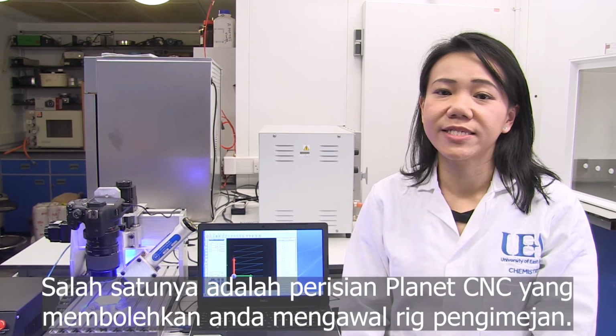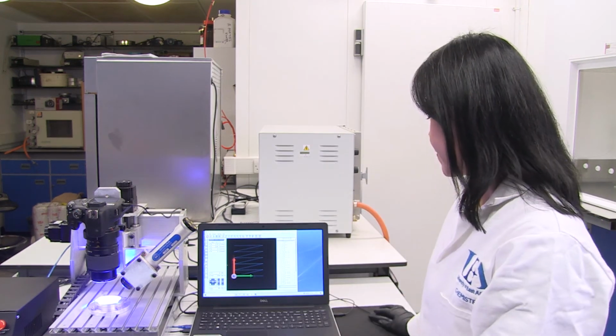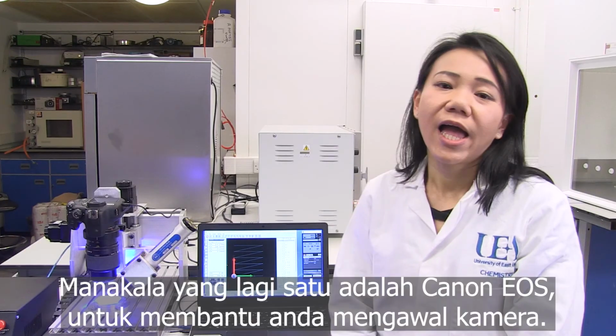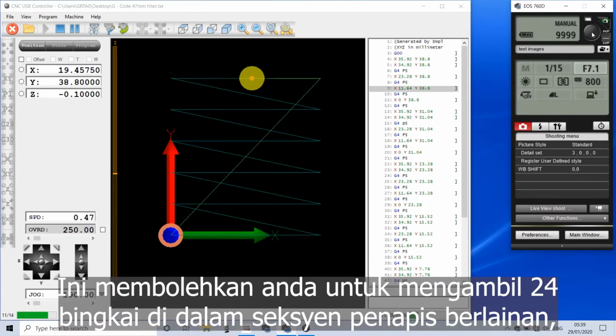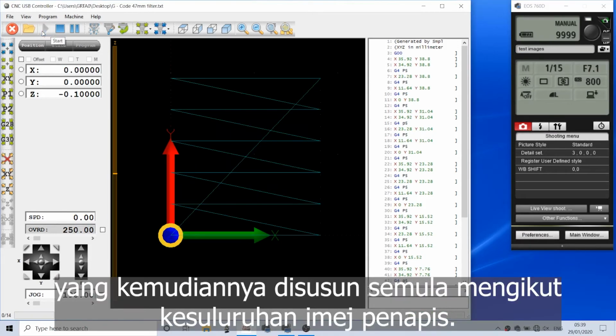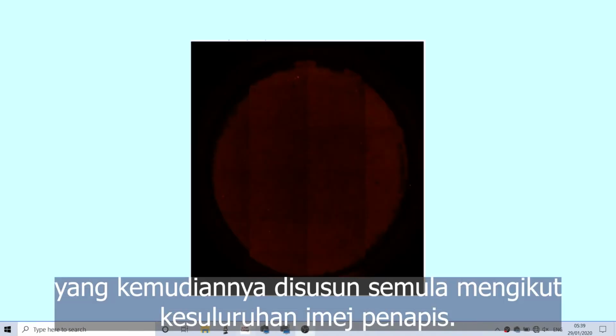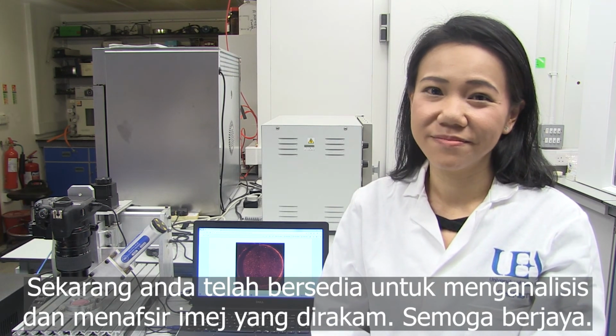One is the Planet CNC software for you to control the imaging rig. Another one is Canon EOS for you to control the camera. This will allow you to take 24 frames of the separate sections of the filter, which is then reassembled into a whole image of the filter. And now you are ready to analyze and interpret the captured image. Good luck!